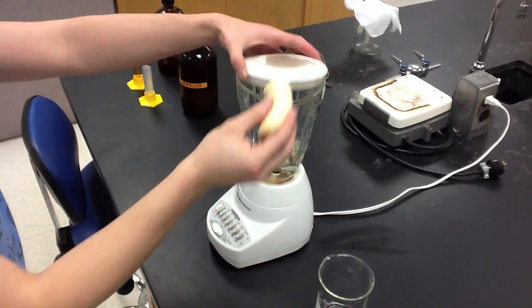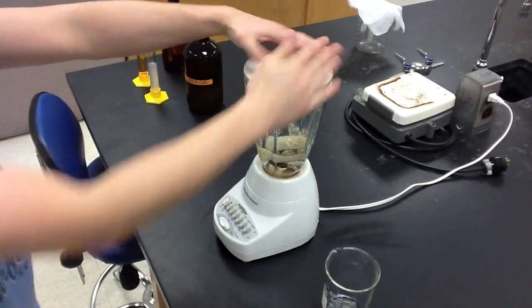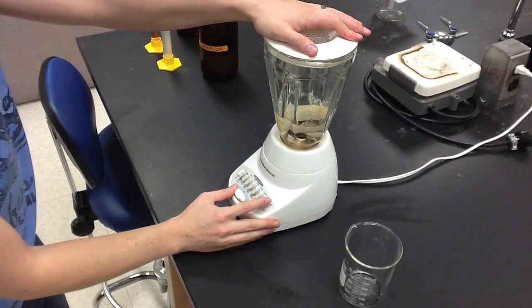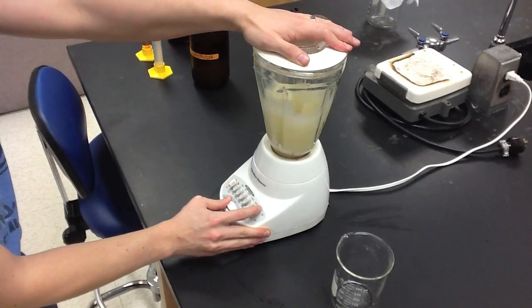In this experiment, we isolated the DNA from a banana, and we started by putting a banana into 250 milliliters of water and blending it.